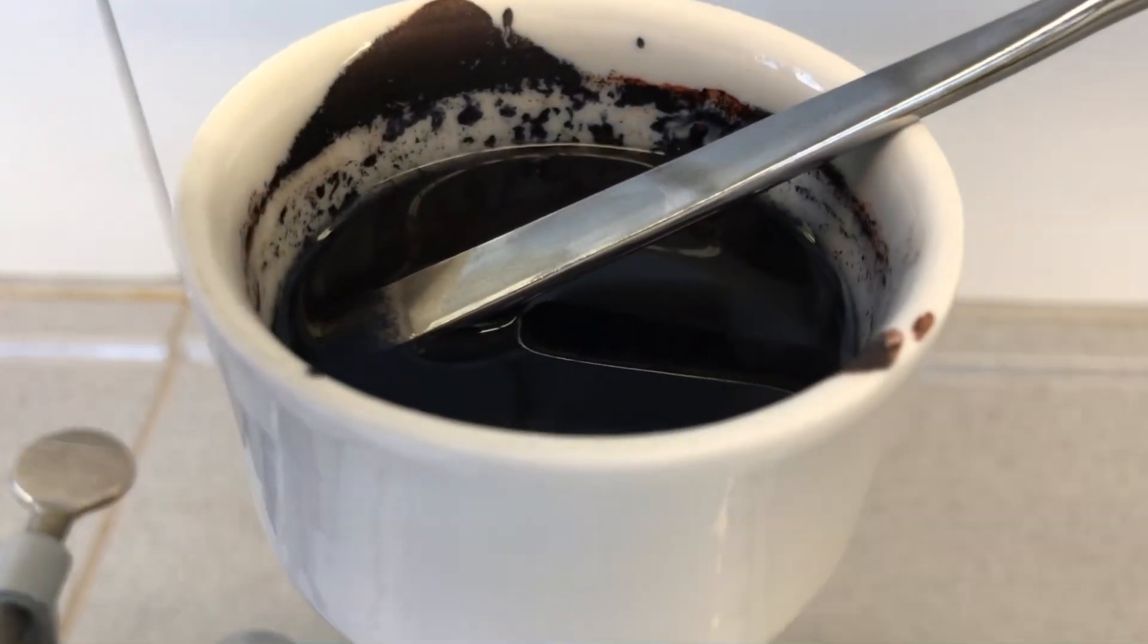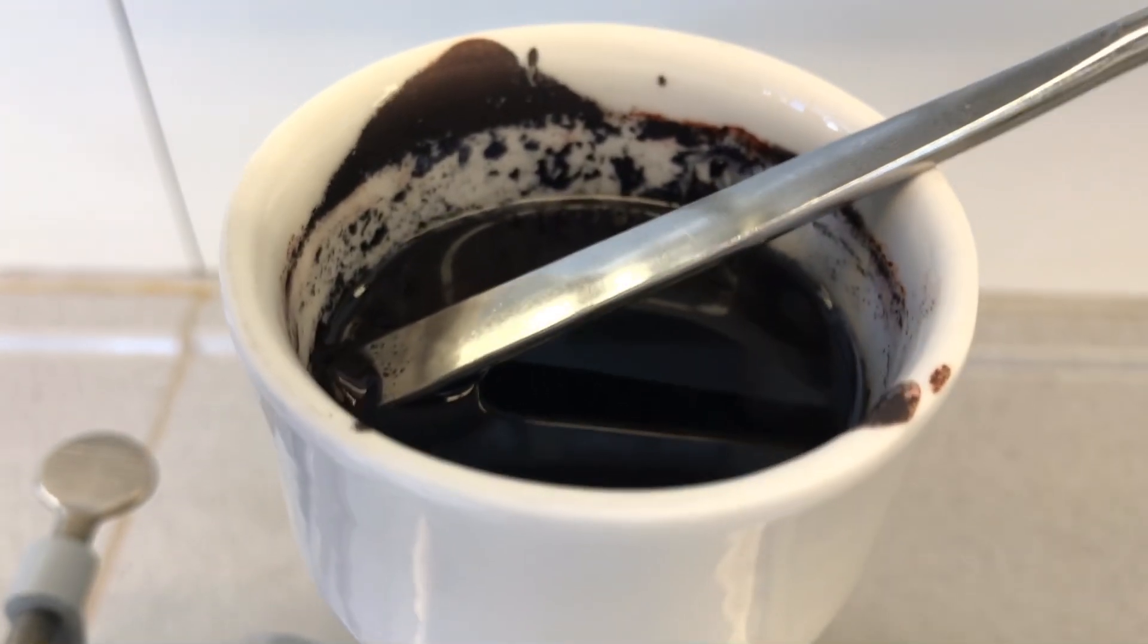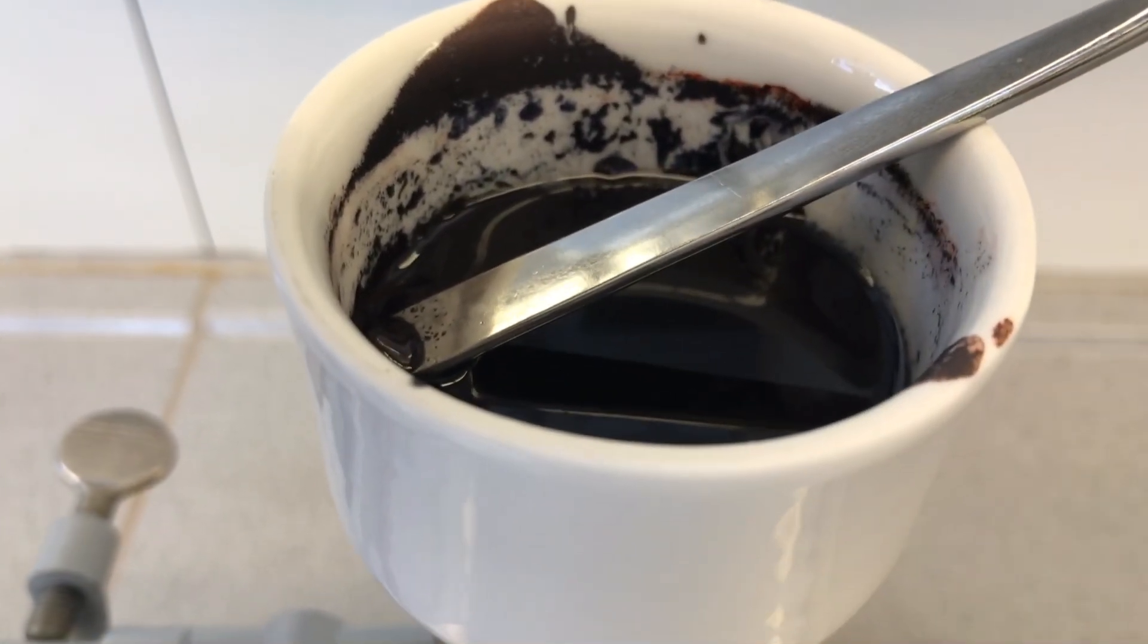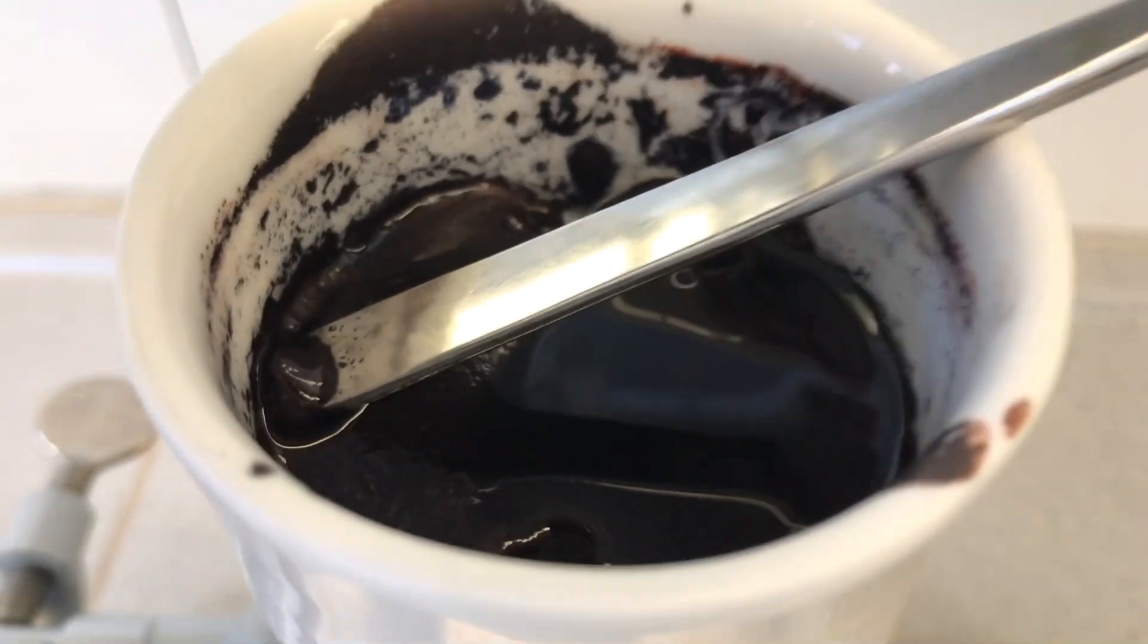For some reason, a lot of the product was sucked right through the filter paper. Maybe the pores were too big. We ended up with a poor yield, so keep this in mind, because this might be the reason for it.